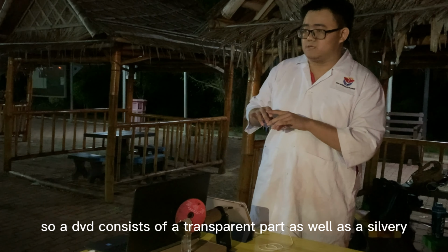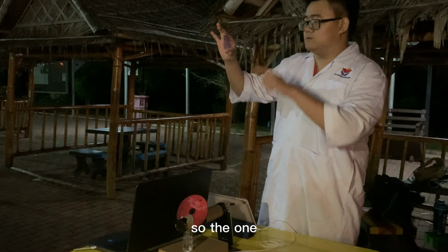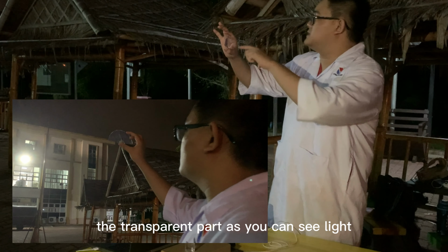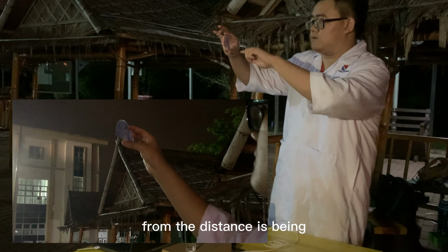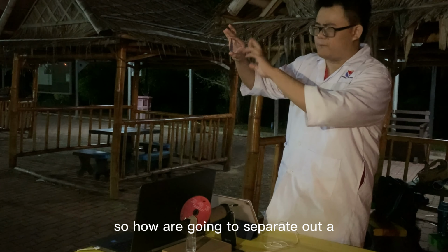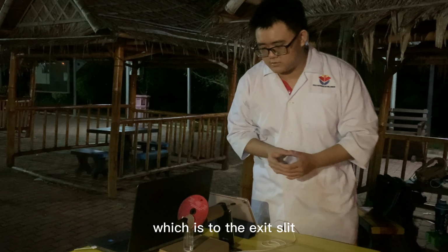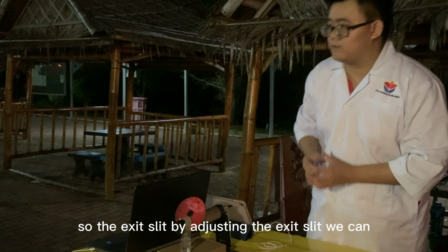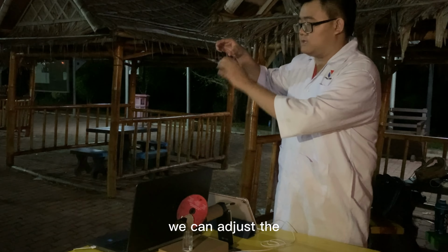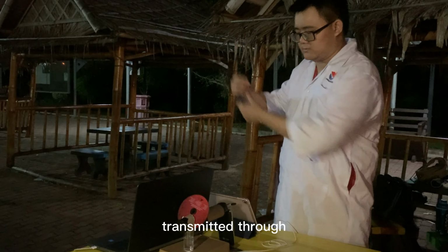A DVD consists of a transparent part as well as a silvery reflective part. The part which does the dispersing is actually the transparent part. As you can see, light from the distance is being refracted into its various wavelengths. So how are we going to separate out a certain wavelength to be transmitted through, which is through the exit slit? By adjusting the exit slit, as well as the angle of the DVD, we can adjust the wavelength of light that is going to be transmitted through.